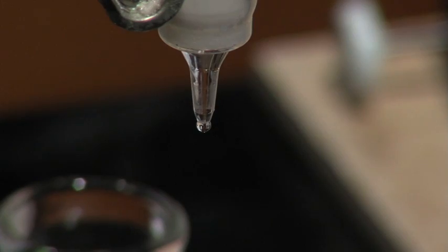For tubes three and four, add six milliliters of 0.1 molar potassium chloride solution. Collect three milliliters in each tube.